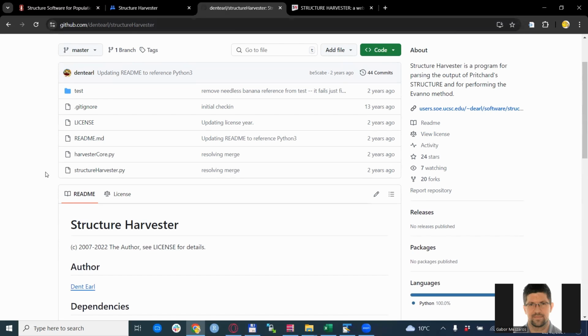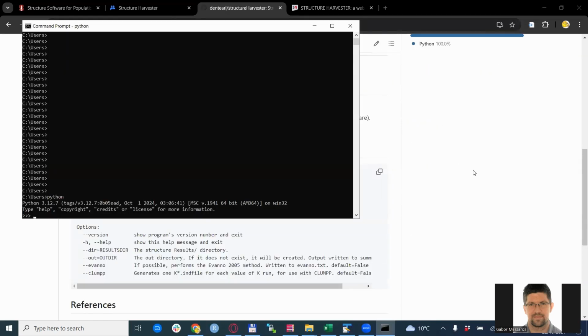So the Python script that you actually need is structureharvester.py. You just download this to your hard drive, and we will start it with Python. You open your command prompt and first test if you have Python installed on your computer. This is a programming language that needs to be installed before you can use it. The easy way to test this: you open your command prompt, and it doesn't matter in which folder you are, you just write python.